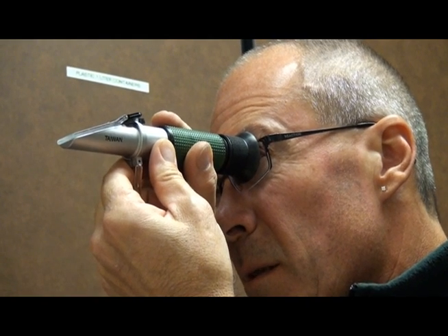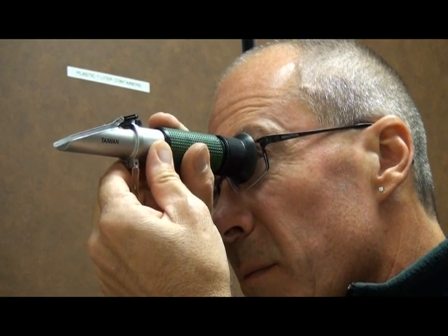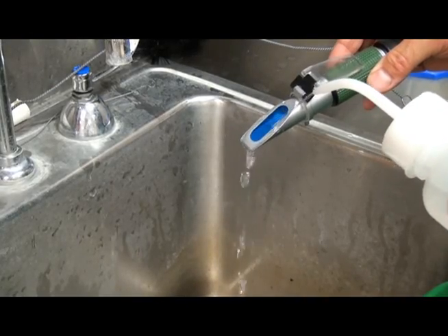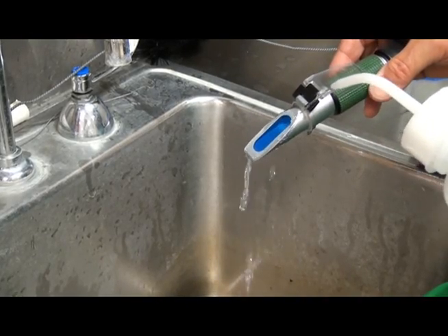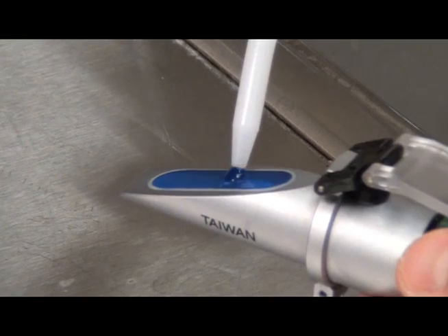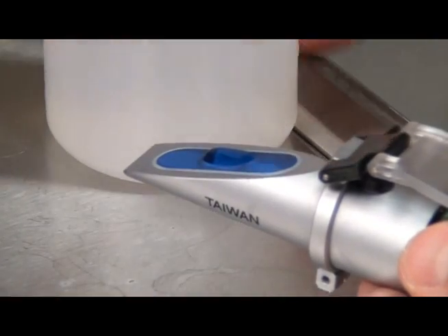In preparation for testing juice with a refractometer, it's a good practice to verify the calibration of the device using DI water. First, clean the refractive lens prism with DI water, then place a sample of the DI water onto the prism.